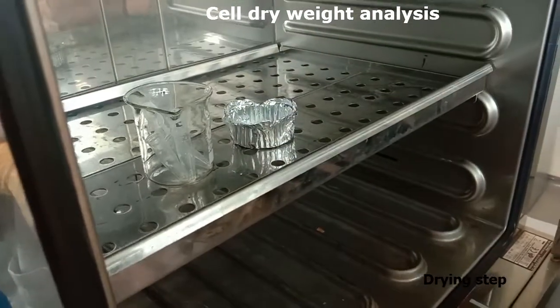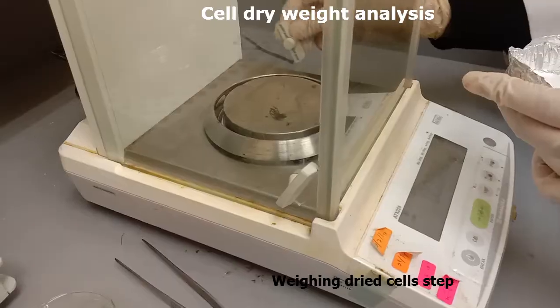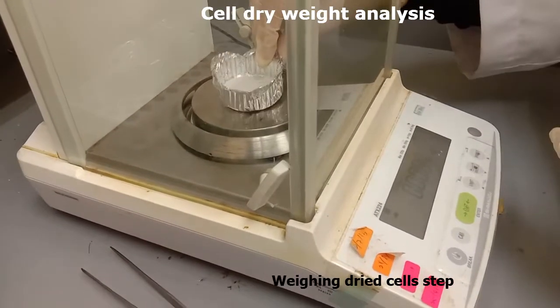Dry the cell pellets and filter membranes in the oven until the weight is consistent, and record the final weight and proceed with data analysis.